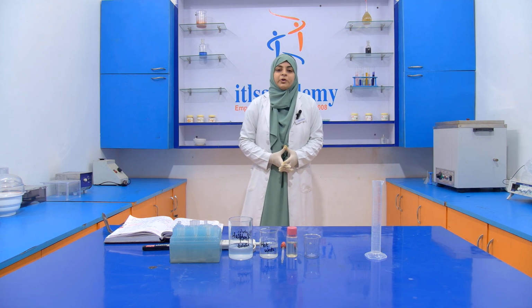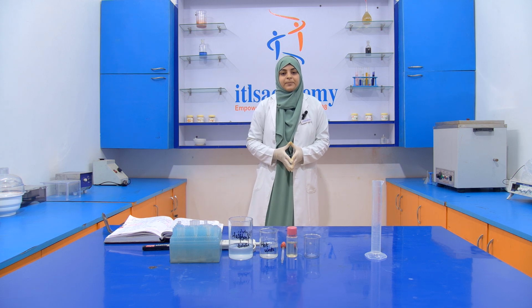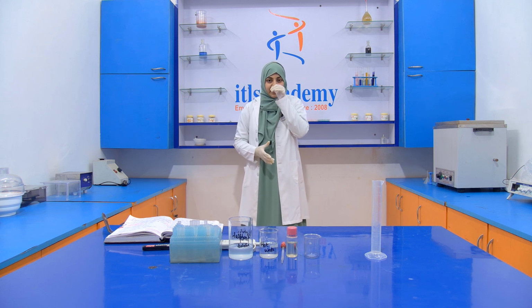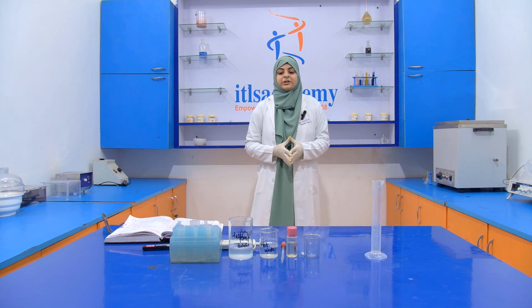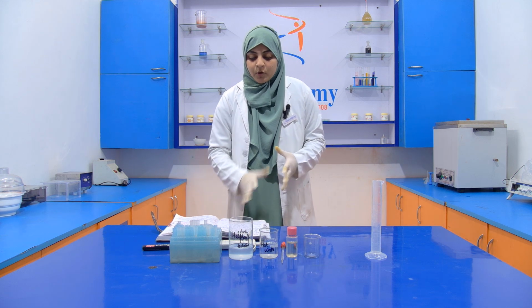Today we are going to perform another series of adulteration tests in an edible oil, in which we are going to perform an experiment, that is the detection of cottonseed oil in an edible oil.